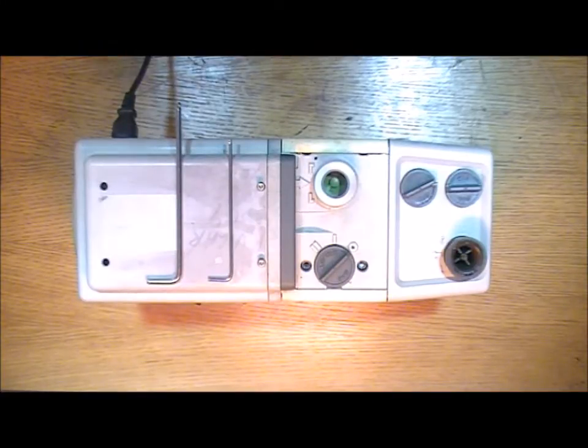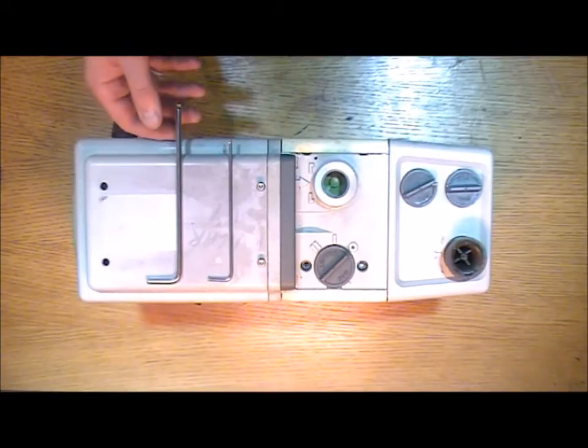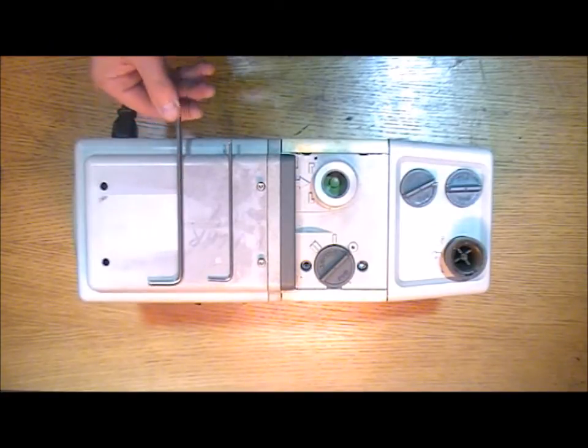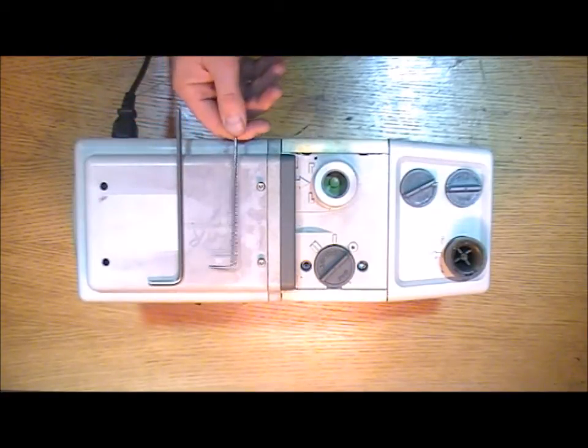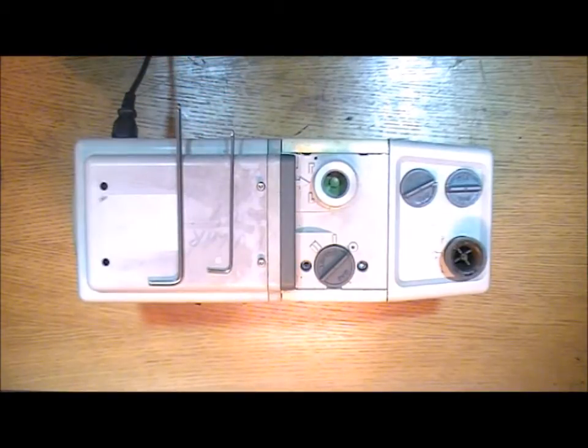To do this you're going to need a couple of allen keys, as you can see here. This is a 5mm for the larger bolts, a 3mm for a couple of the smaller ones.